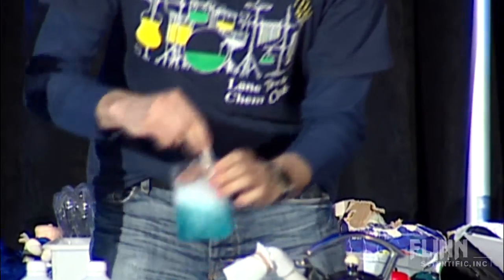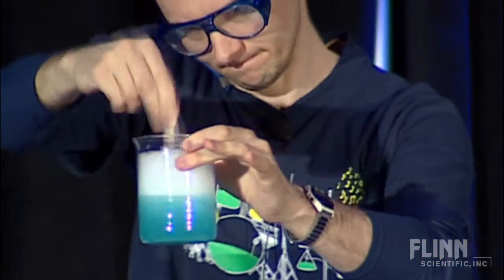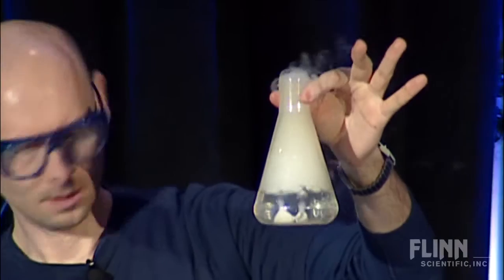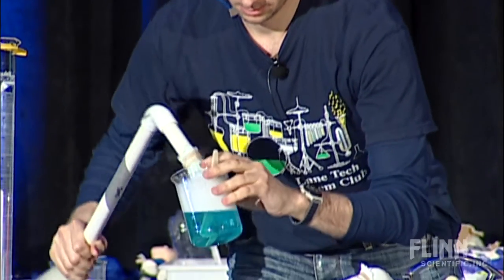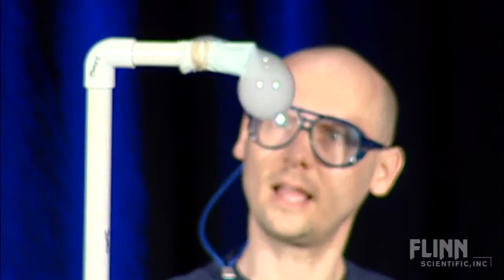The first thing I have is some soapy solution here that I'm just agitating to get some bubbles. Then I have this Erlenmeyer flask with a couple pieces of dry ice. I'm going to cap it here with this PVC piping and dunk the actual tip of this in the soapy solution. Once enough gas gets collected, you'll actually see it start to form a bubble at the end — as you can see here. And the kids go bonkers when they see this.